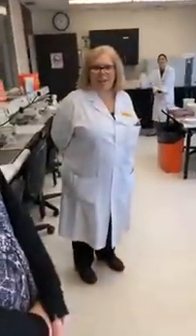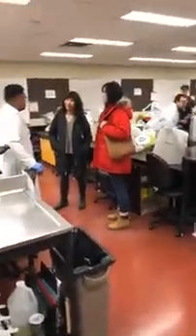We're going to move on to the microbiology lab next. This is the microbiology lab — you can see we've got a lot of visitors here already.